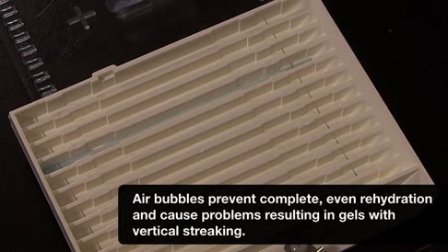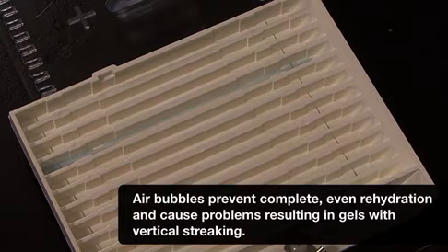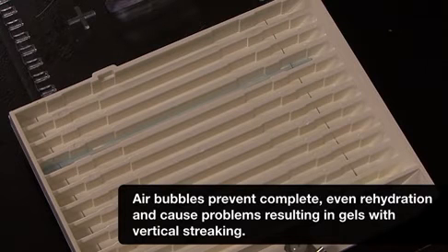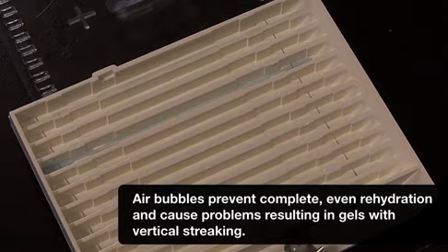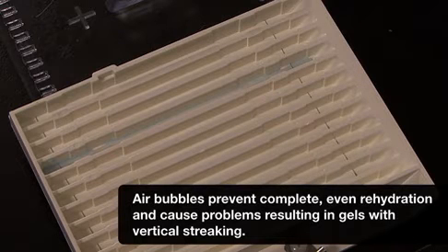If you don't remove air bubbles, there will be areas in the IPG strip that do not rehydrate properly and that will cause serious anomalies in your first dimension isoelectric focusing run.